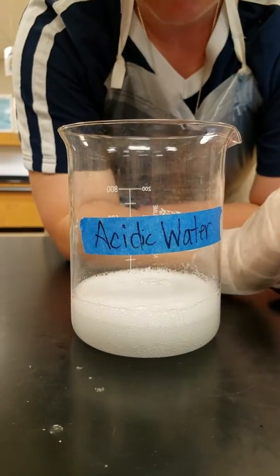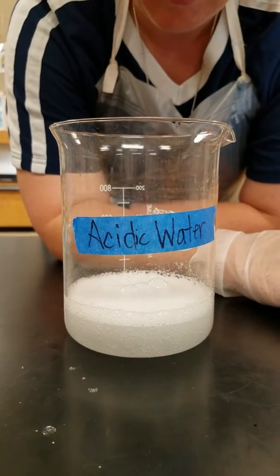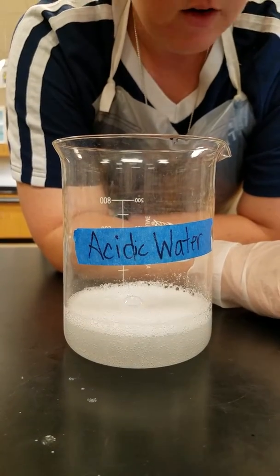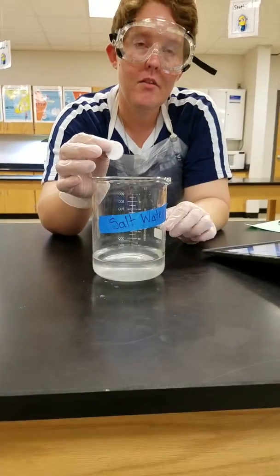Yep. Still see it in the middle. There's still a lot of bubbles coming from exactly the middle, really big ones, saying that the tablet is still there. Alright, so we're going to stop it. You ready? Yeah. Alright, so now we have our salt water.